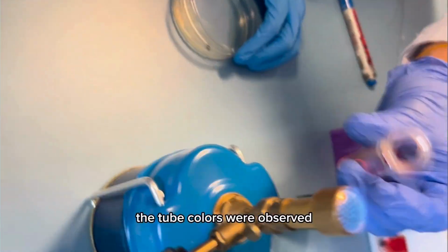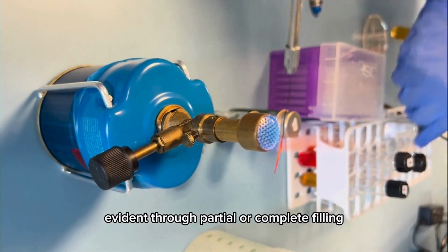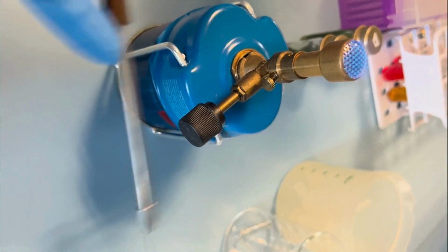After incubation, the tube colors were observed with yellow indicating acid production. The Durham tubes were checked for gas production, evident through partial or complete filling. Results were recorded based on the observed color changes and gas production.